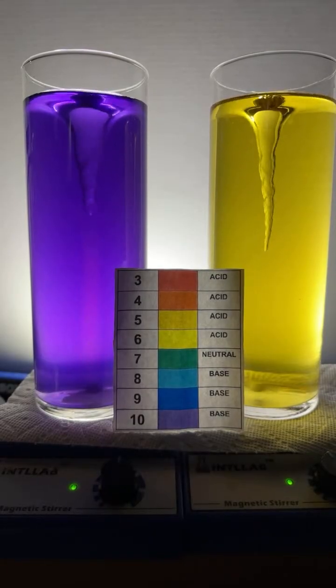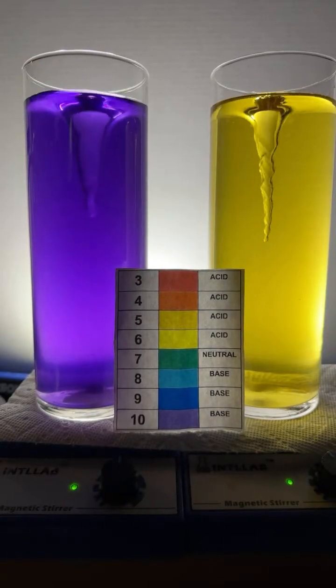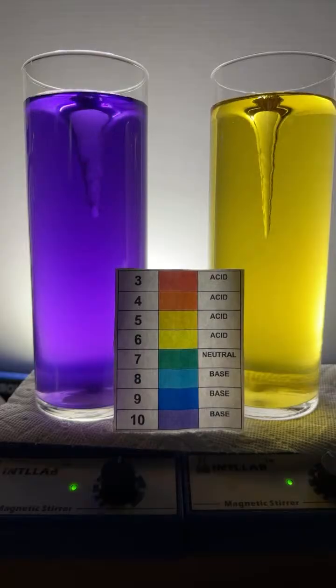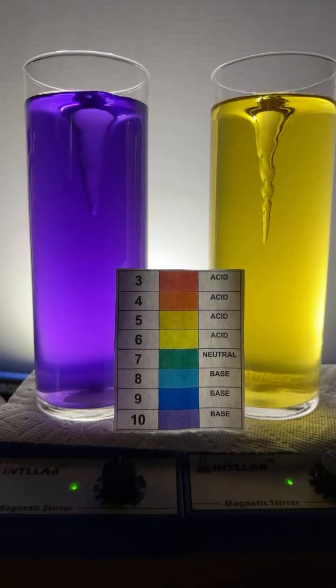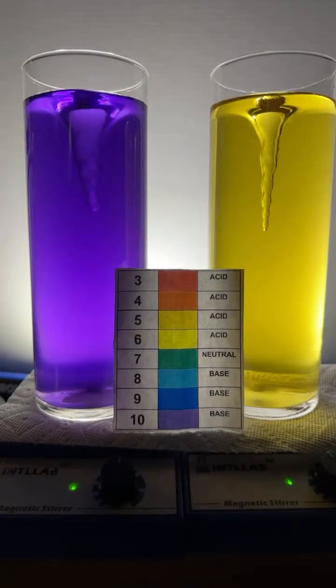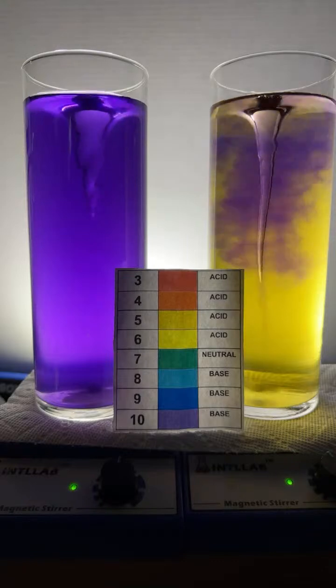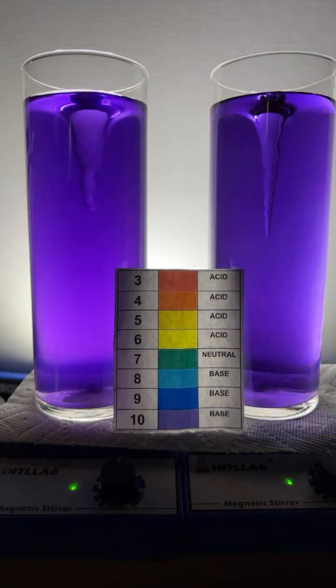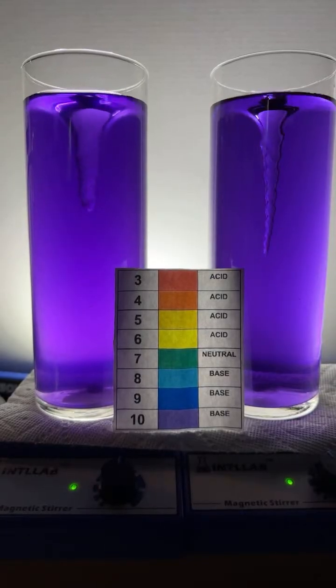Rika, the base I'm using is sodium hydroxide. That's a good question, Fidro. When am I going to do something different? That's fair enough question. I don't know. And I do some different experiments. I do. But this is my go-to for sure. What indicator I'm using, Fennec? I'm using universal indicator. All right, Crab wants blue or green.